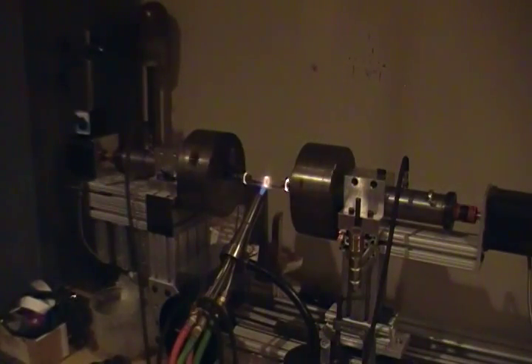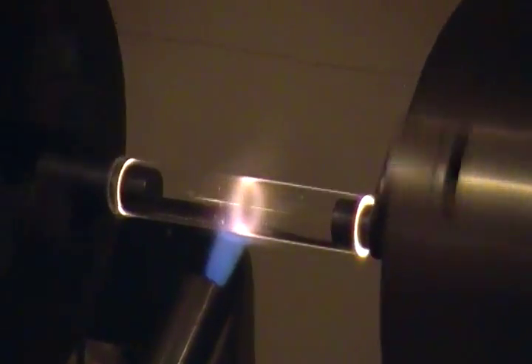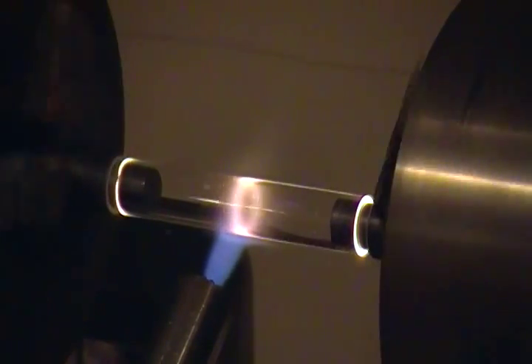Quartz has almost no emissivity, so every speck of dust, any contaminant you see on the surface of the material, it glows and emits light much more efficiently than the quartz material does. The quartz just doesn't emit light. It's got a very low emissivity as a black body radiator. So it's very interesting when it's in the flame. You actually have to get it white hot to work it.